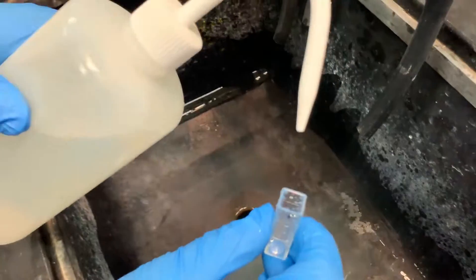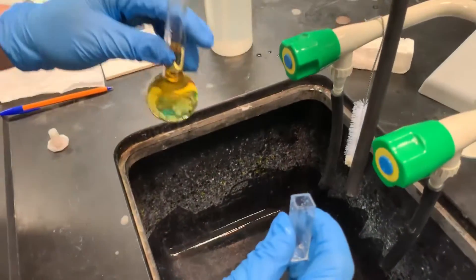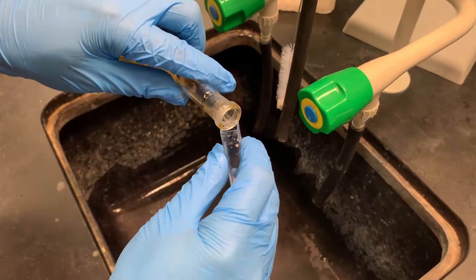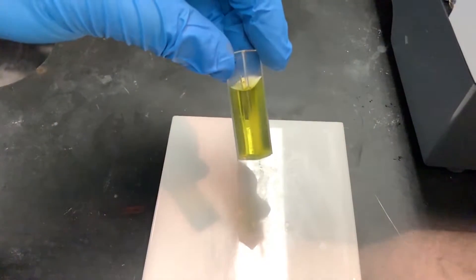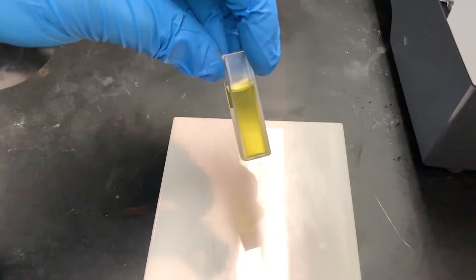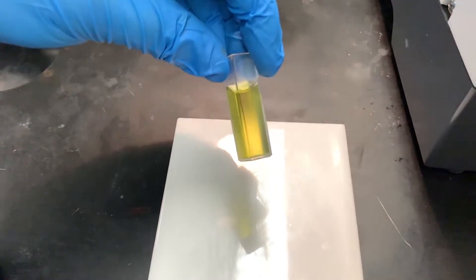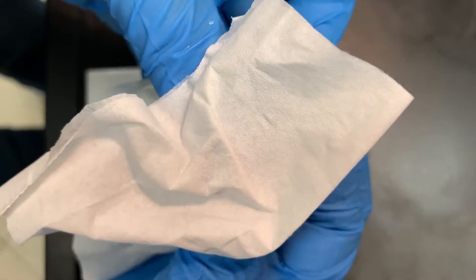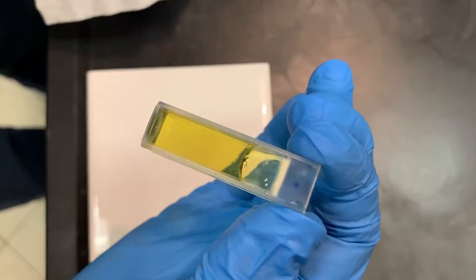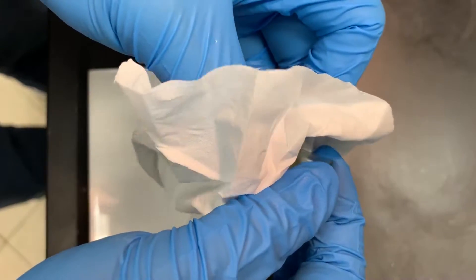To prepare the cuvettes, wash the cuvette with deionized water and rinse it with the solution you are about to use for the analysis. The cuvettes have two translucent sides and two clear sides. When handling the cuvettes, always handle them by the translucent sides and keep the clear sides clean at all times.